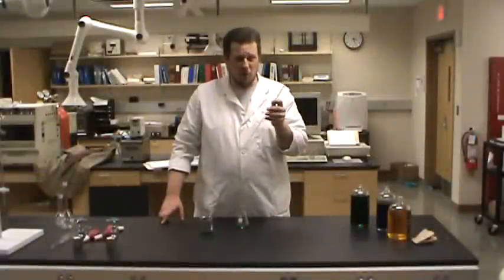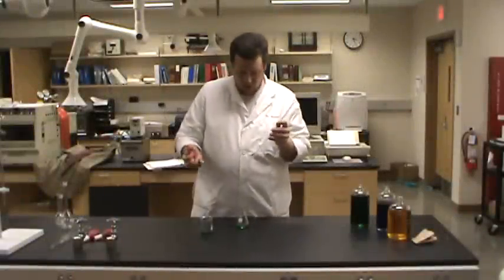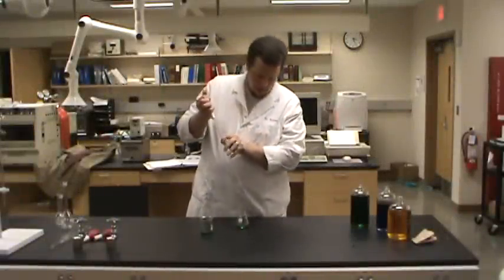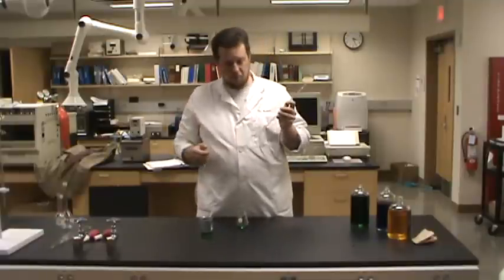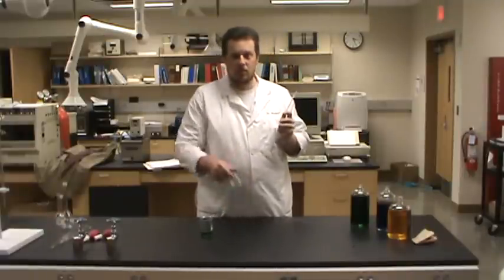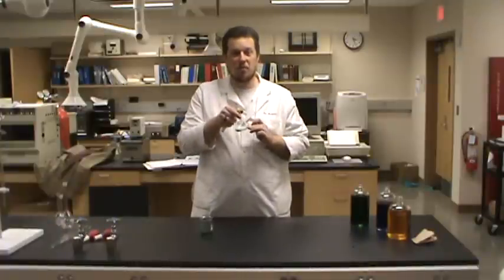If you look at the tip of that pipette, there's still a little bit of liquid left in it. It's very important that that liquid is in there. Because what? This pipette is calibrated to deliver 5 milliliters. So any liquid that stays in the tip is supposed to stay in the tip. So the thing that everyone's always tempted to do is, well, take that bulb and blow all the liquid out. But what have I just done? I've just delivered more than 5 milliliters.